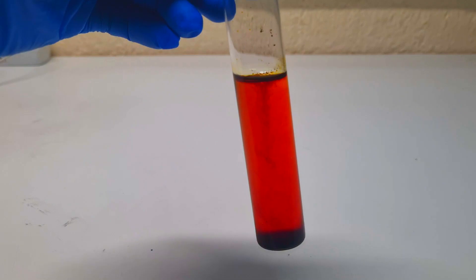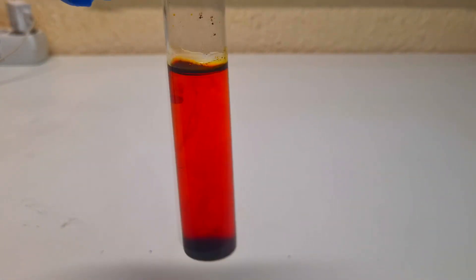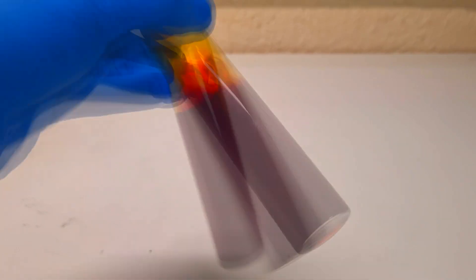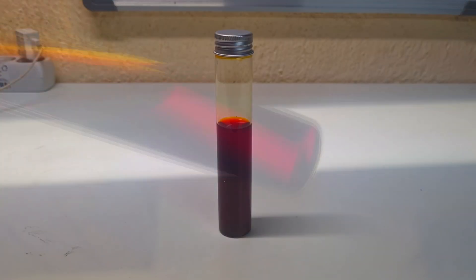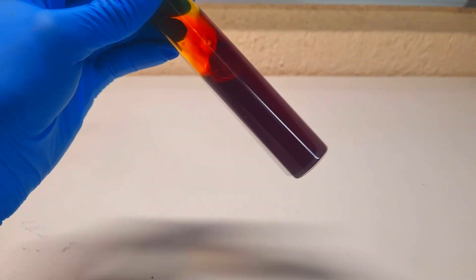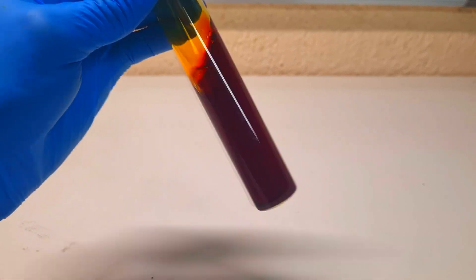I need to wait for most of the iodine to dissolve. After a couple of seconds, all the iodine was dissolved in this potassium iodide solution.